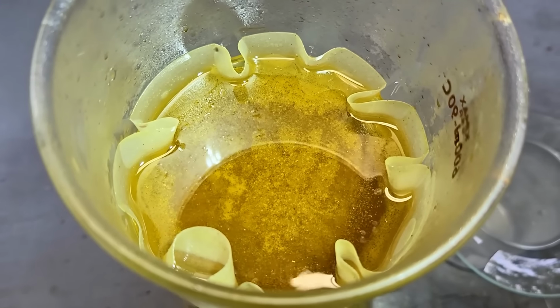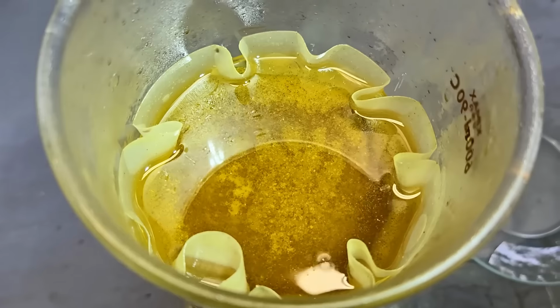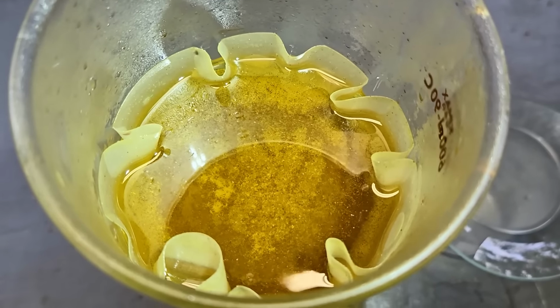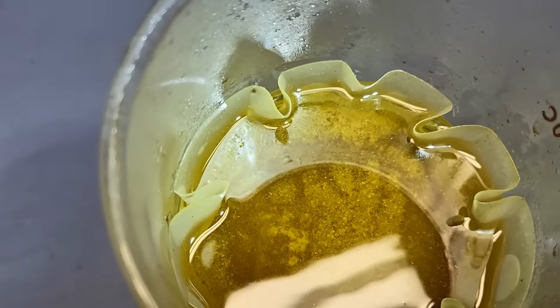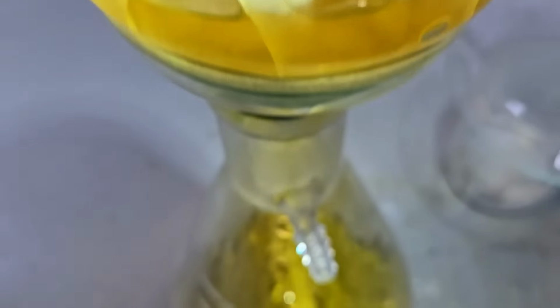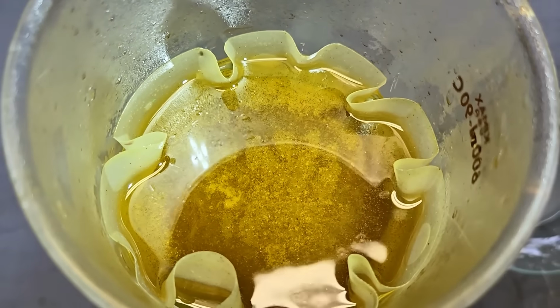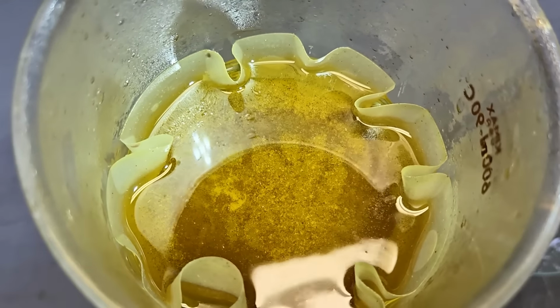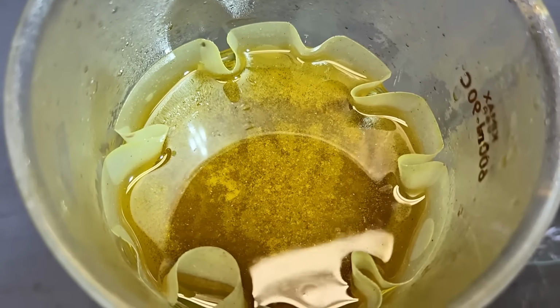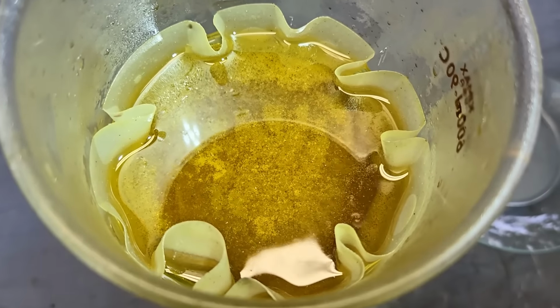Yep, most of the aqua regia has gone through the first time. Look at that gold in there just bubbling away as it dissolves. What's left of it, most of it's gone. Down here now. But I will definitely run this liquid through a second time just to make sure I get every last trace of that gold in solution. It's going pretty quick, which is great.